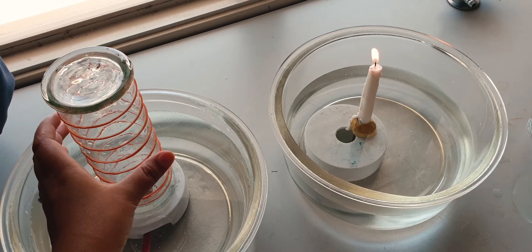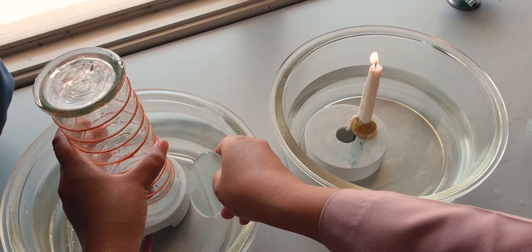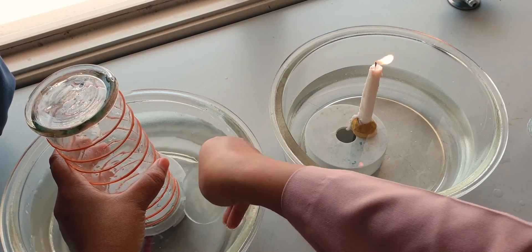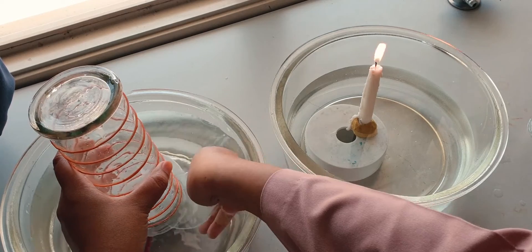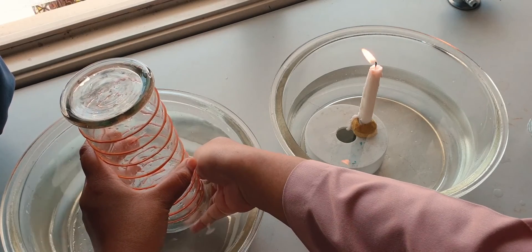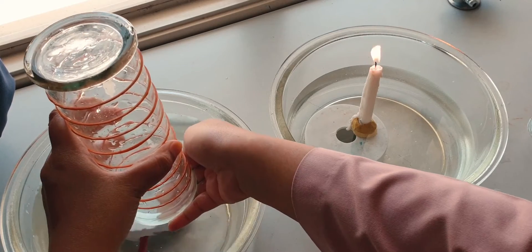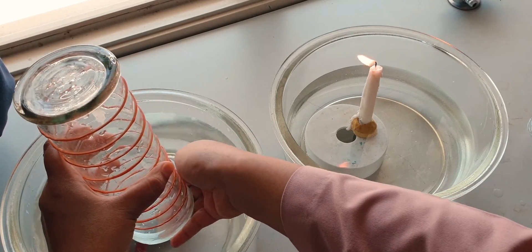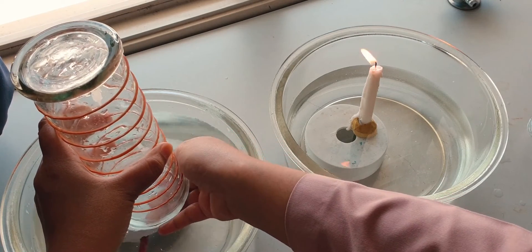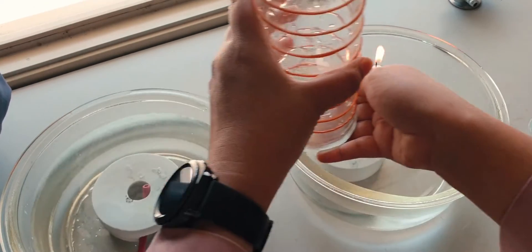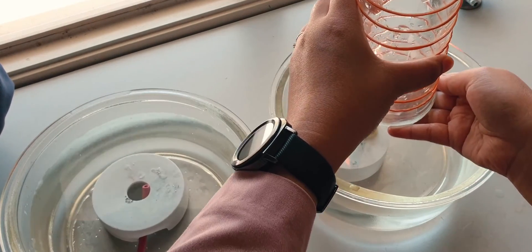I'm going to carefully cover this one up and take it out. I should remove the water out, and I will carefully invert it onto the candle.